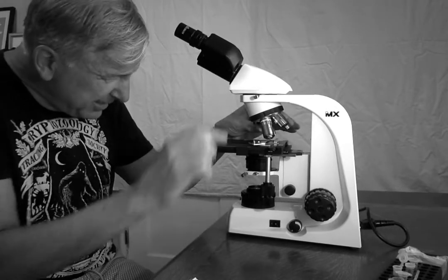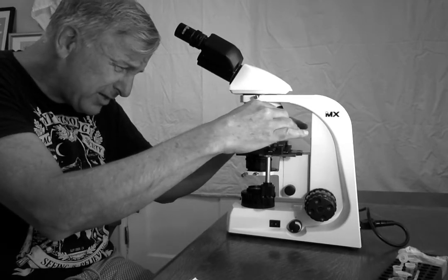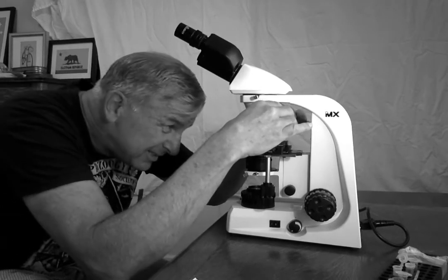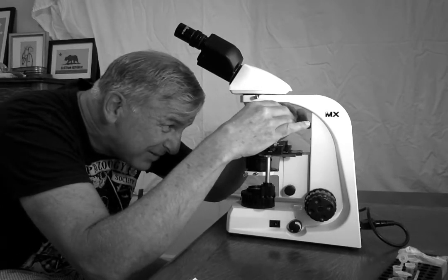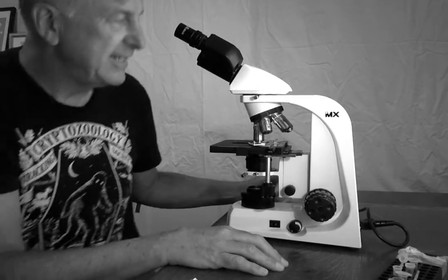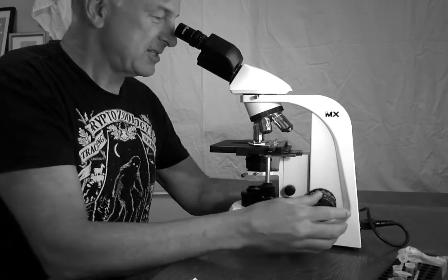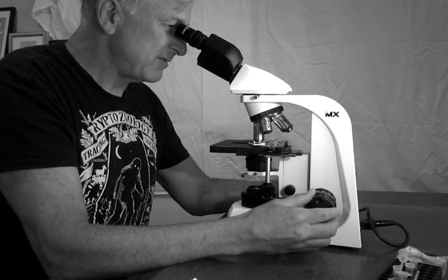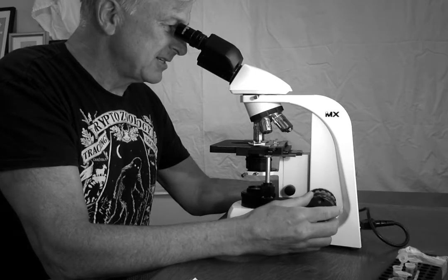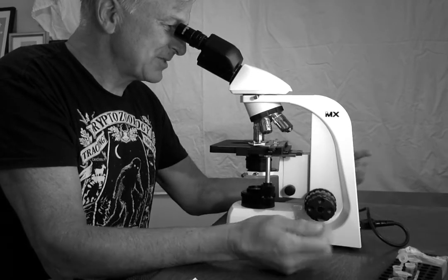I see a white band around it on this microscope. Sometimes I lose track of which objective is which. They are color coded. And if I get down to the level, I will see the lens go right into the oil. And now I'm going to take a peek again and just delicately move the fine focus knob. And oh my goodness. So now features are being magnified 1,000 times.